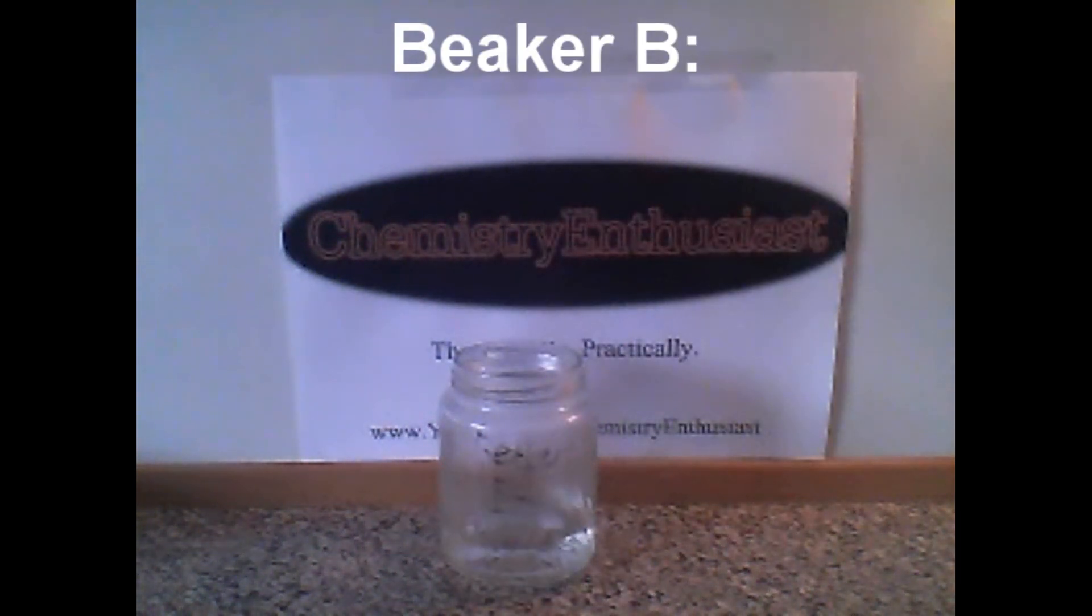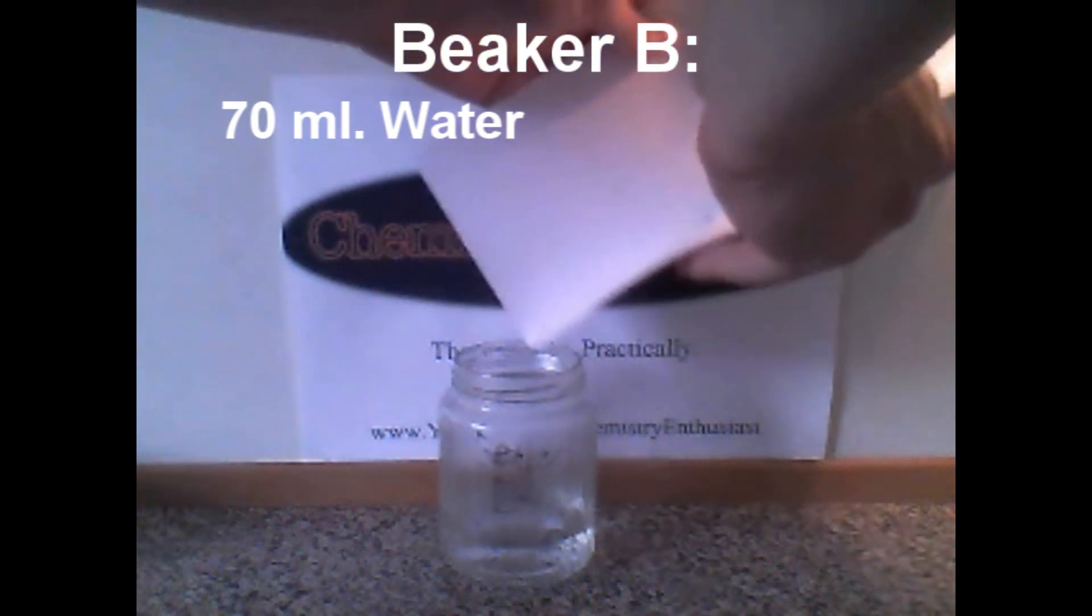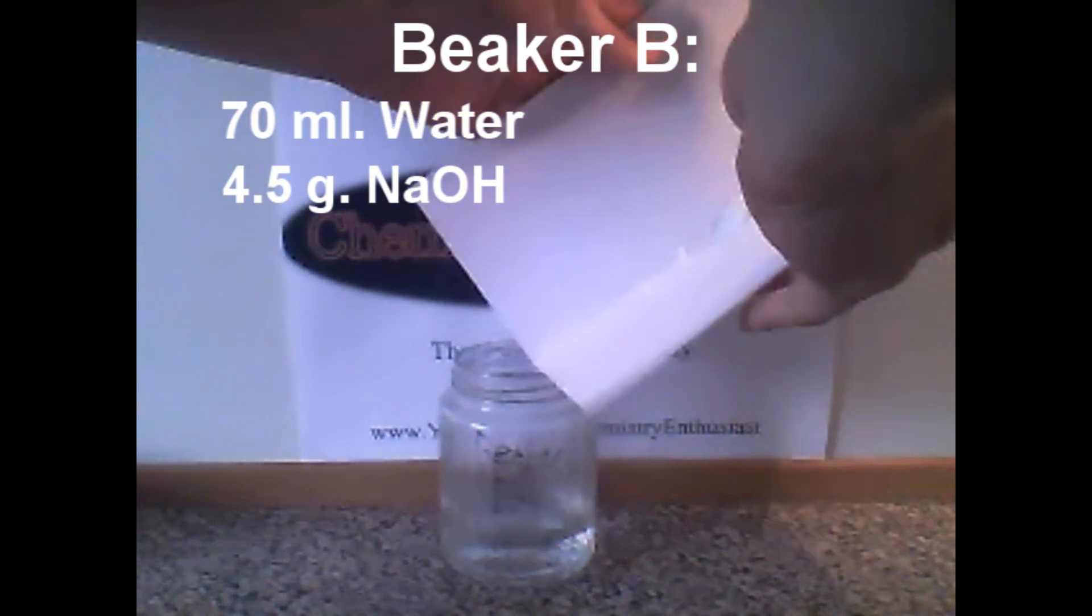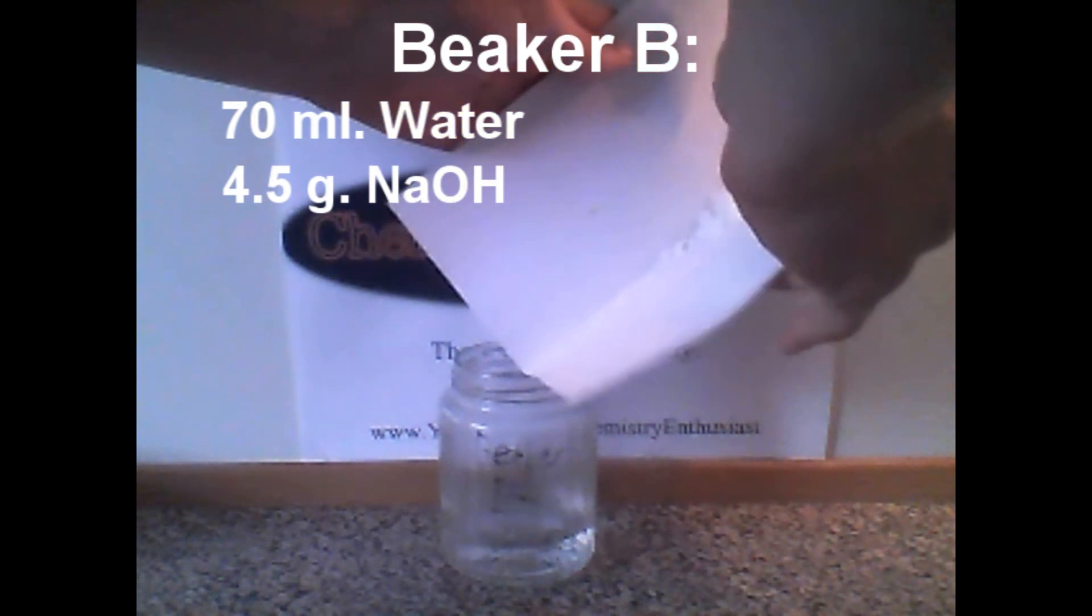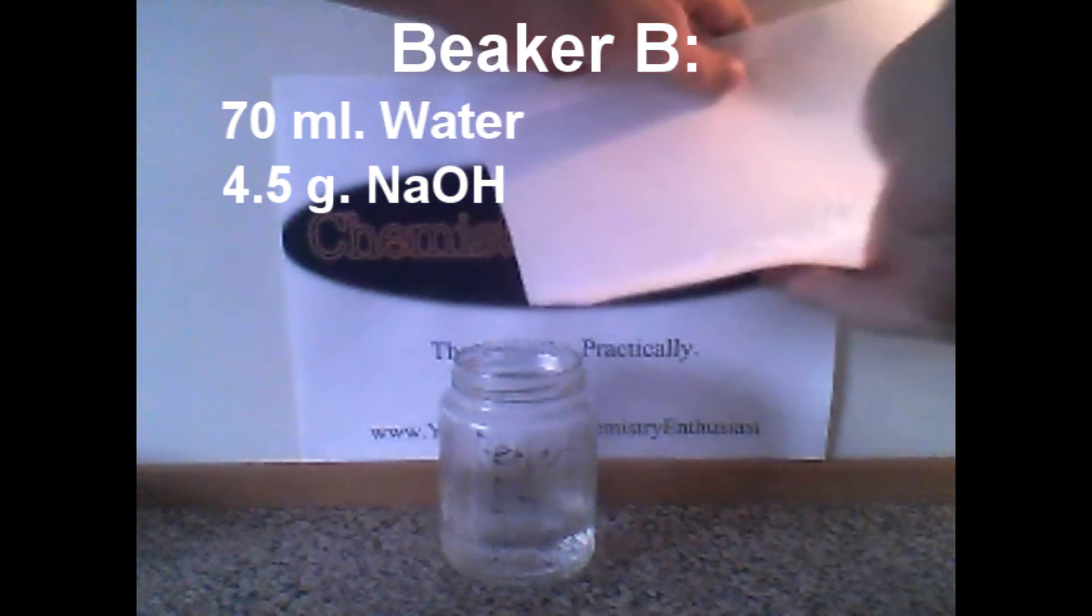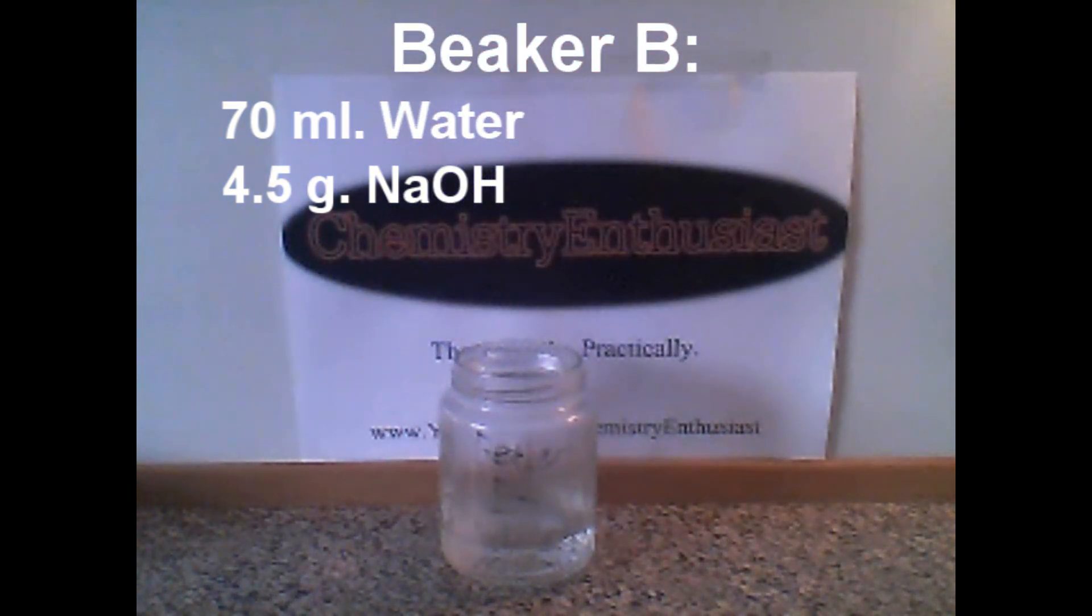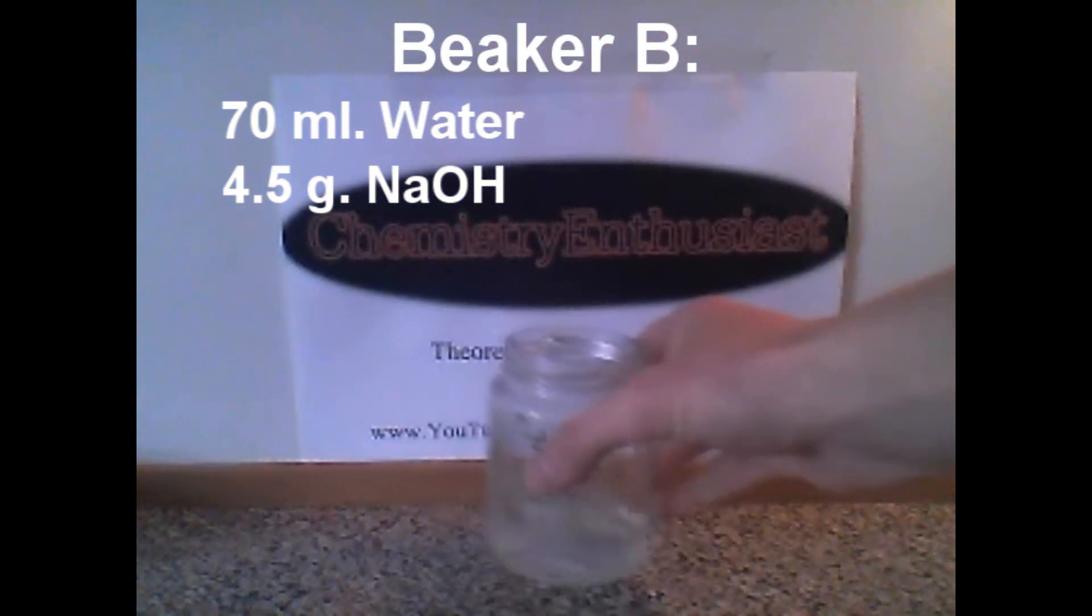To this add 70 ml of water, 4.5 g of sodium hydroxide, and as you can see I had some problems with the chemicals sticking on the paper.